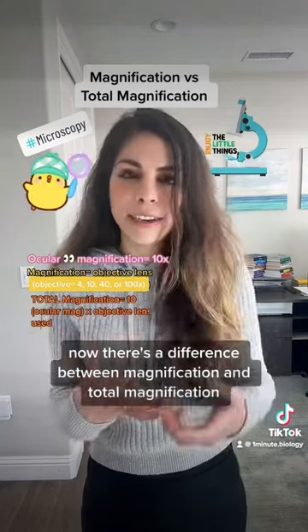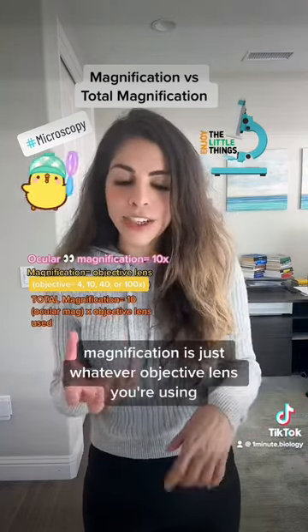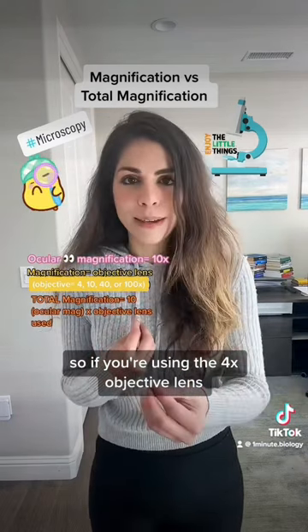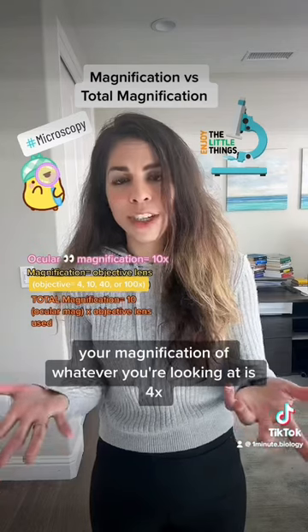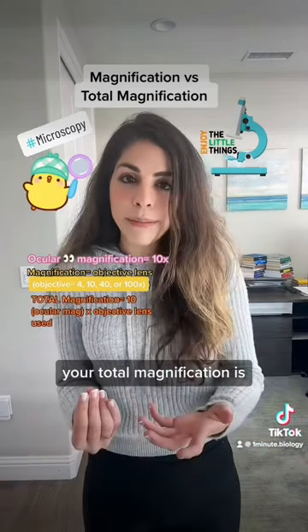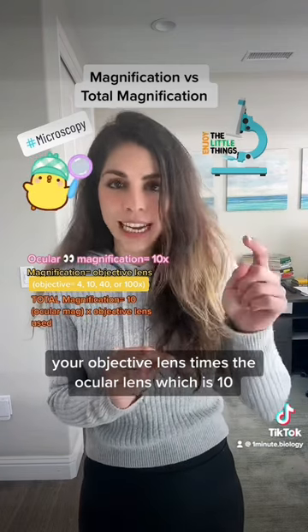There's a difference between magnification and total magnification. Magnification is just whatever objective lens you're using — so if you're using the 4x objective lens, your magnification is 4x. Your total magnification is your objective lens times the ocular lens, which is 10.